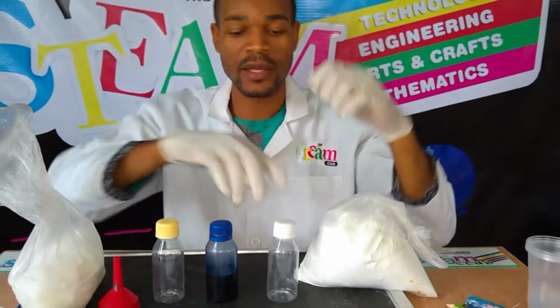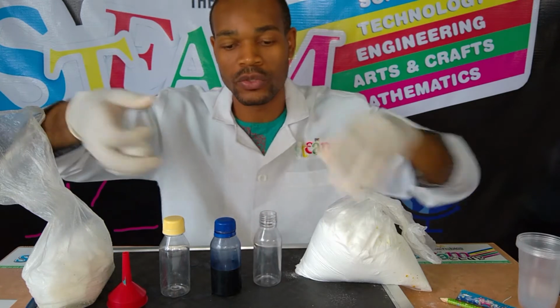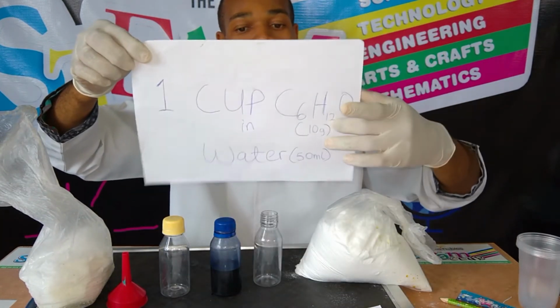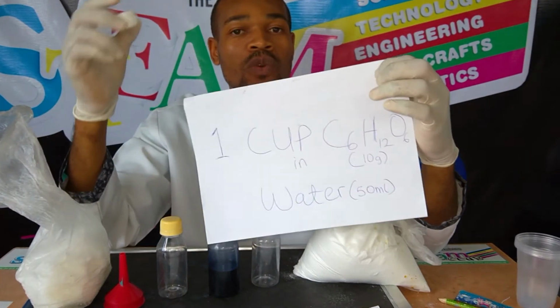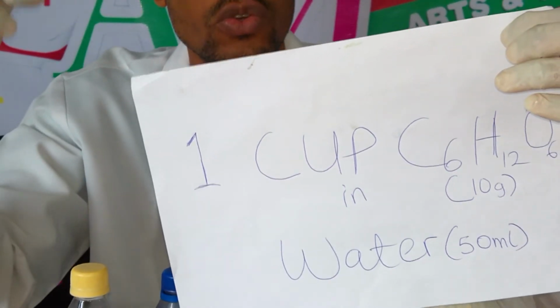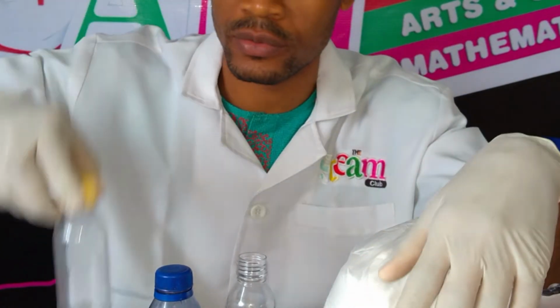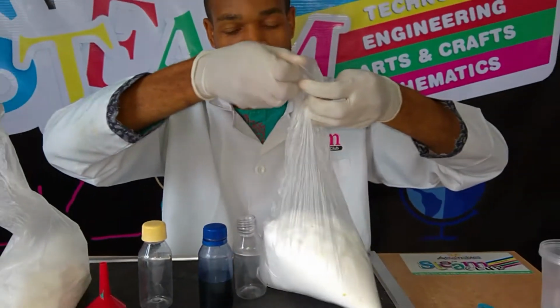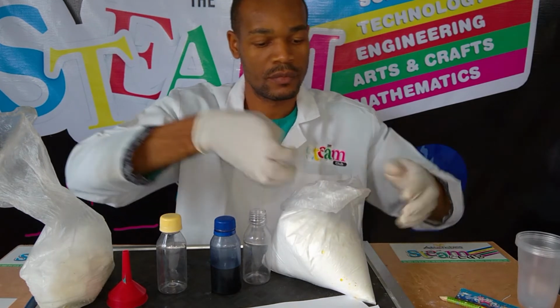Now I'm going to be taking 1 cup each of both. As you can see here, this is 1 cup of glucose, and my cup of glucose is somewhat synonymous to 10 grams of glucose. And the water I'm going to use is just going to be half of this bottle, which is like 50 ml. So I'll go ahead and take that.